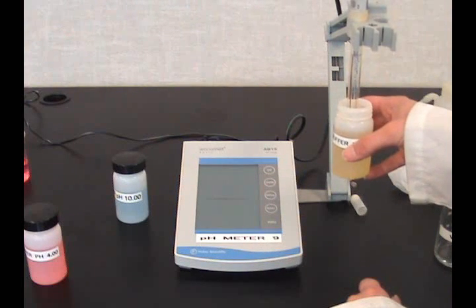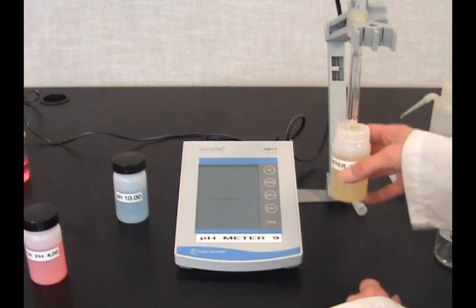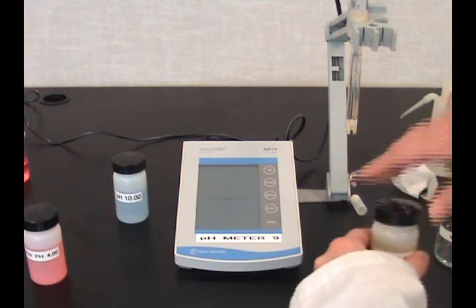Press the standby button and remove the probe from solution. The probe should be kept in solution at all times when the meter is turned on.